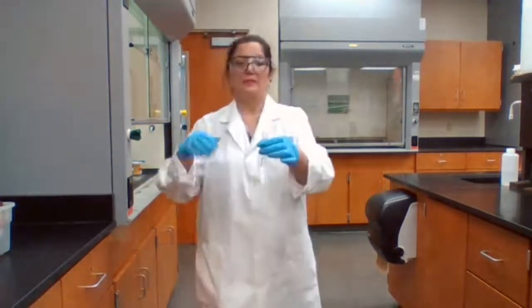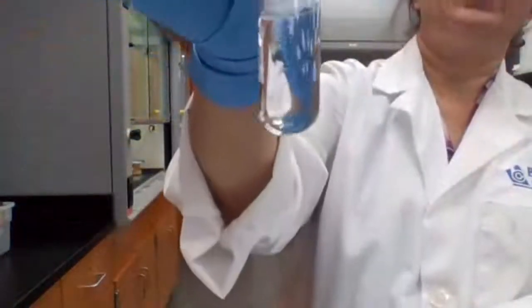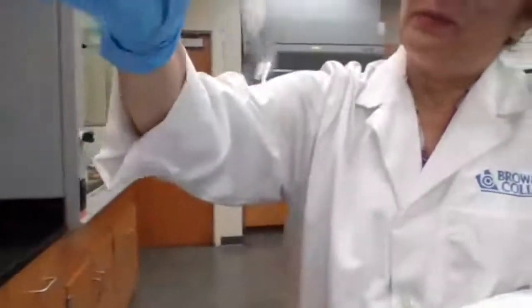Okay. This is what happened when I added nitric acid. Make sure you record your observation. And I'm done with part 1.